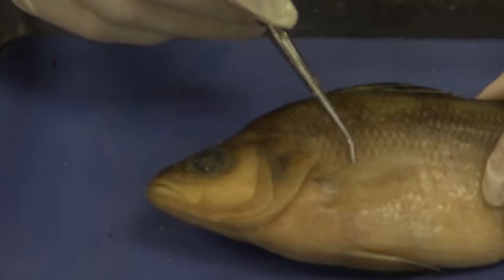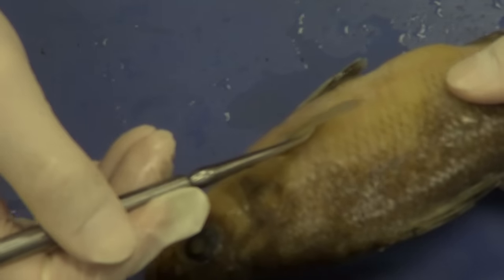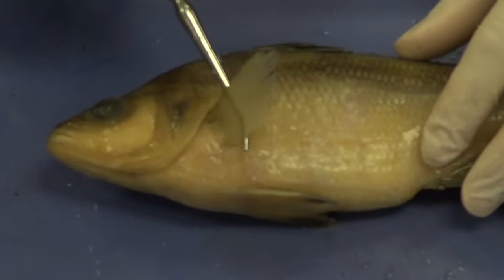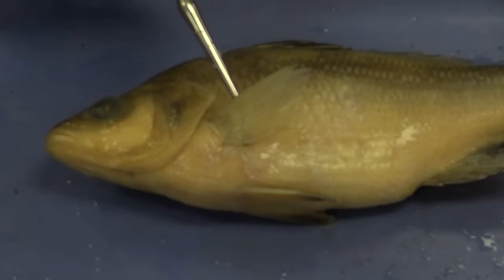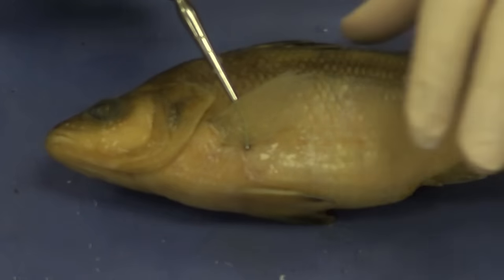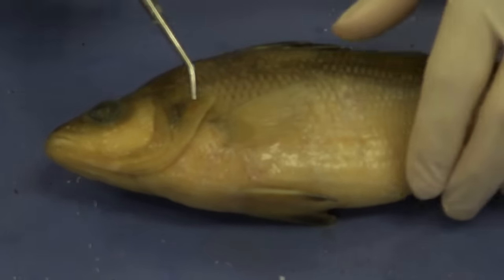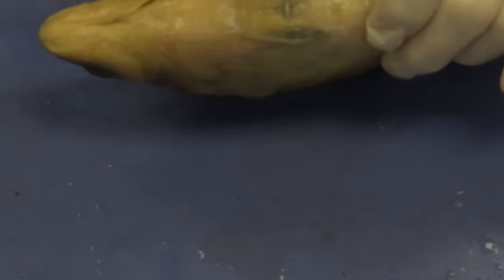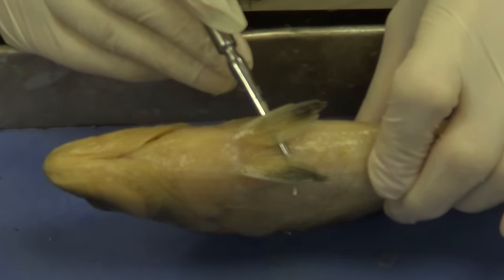If we go a little further on the side, we see a fin on each side. This fish has paired fins, which help it maneuver and stabilize in the water much better than a fish with only a single fin down its back like the lamprey. This fin is called a pectoral fin. Down here we have a set of paired fins called pelvic fins.